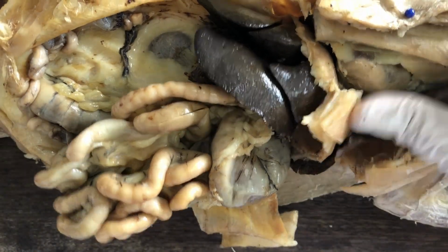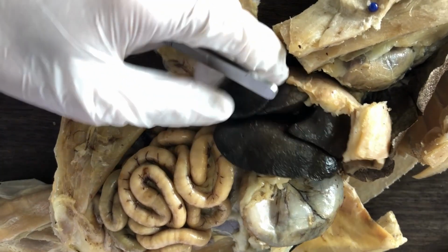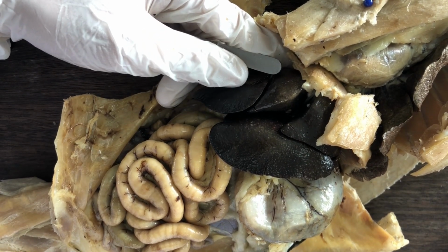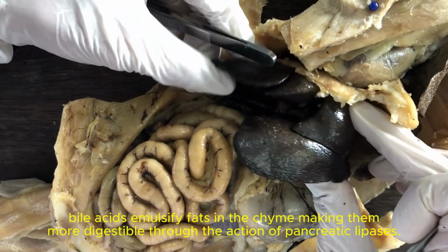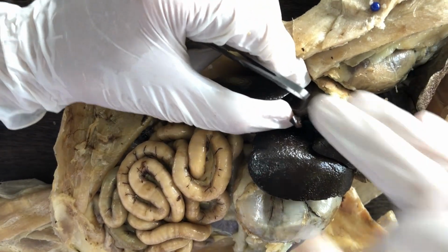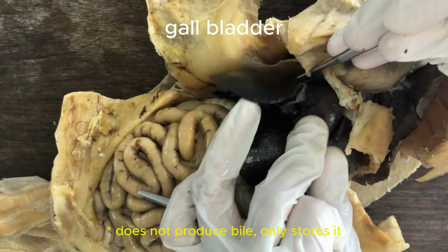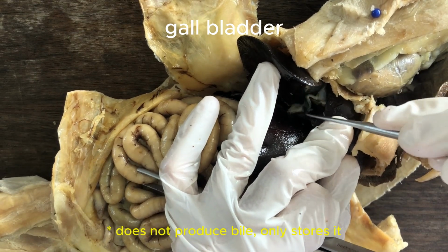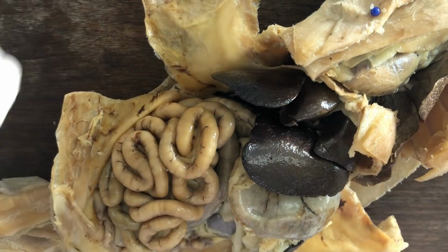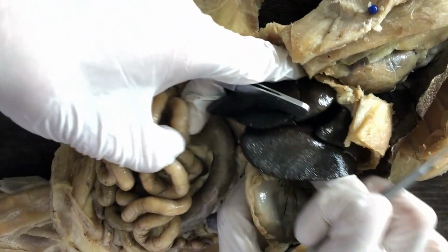So let's examine more closely those accessory digestive organs that I just mentioned. The liver has a lot of functions. You can read more about them, but one is, as I said, the production of bile, which will help in digestion of lipids. Right? And so the liver will produce that bile, but it will temporarily store it in another organ called the gallbladder. That greenish sac there, in this case already collapsed, is the gallbladder. That's where bile is temporarily stored until needed, when the chyme has already reached the duodenum.